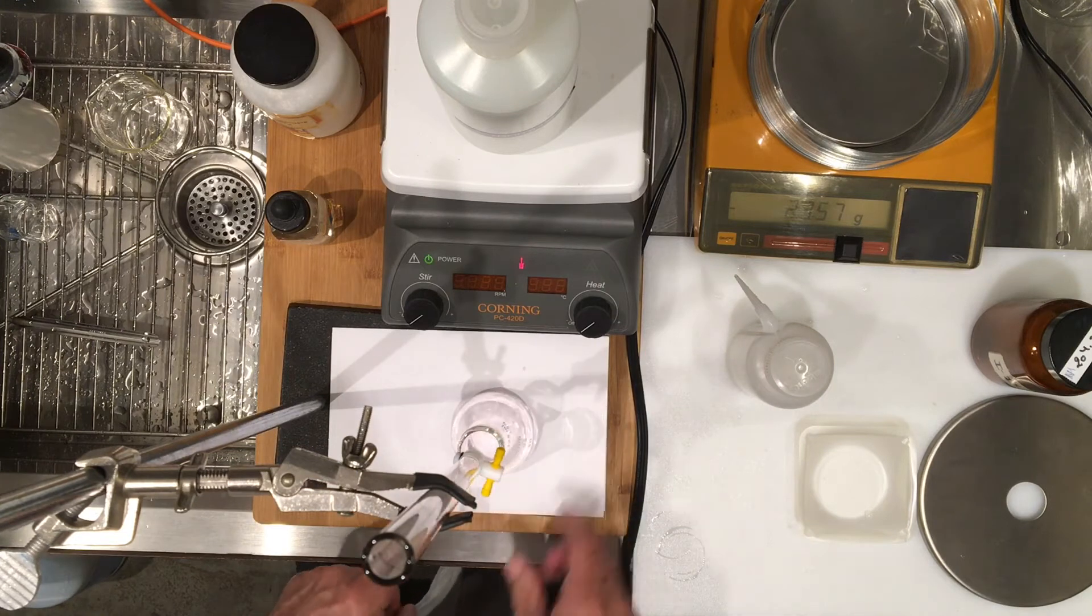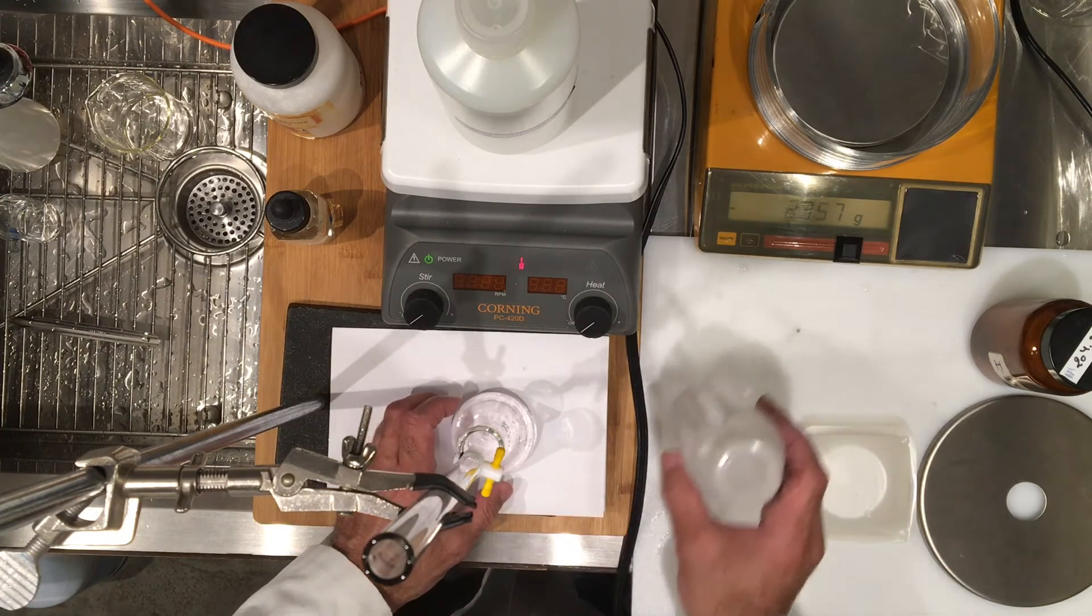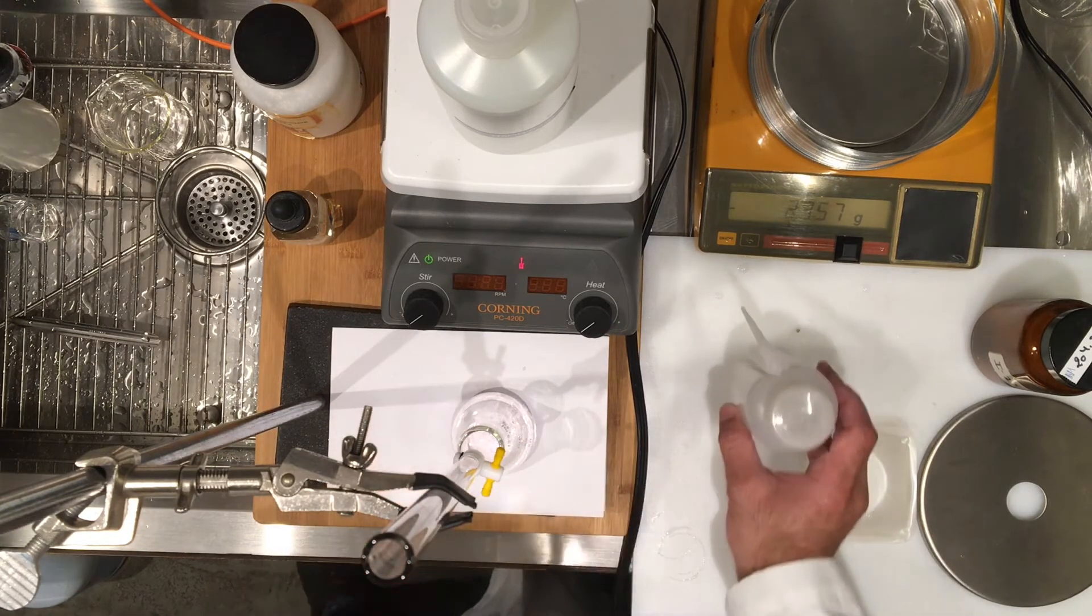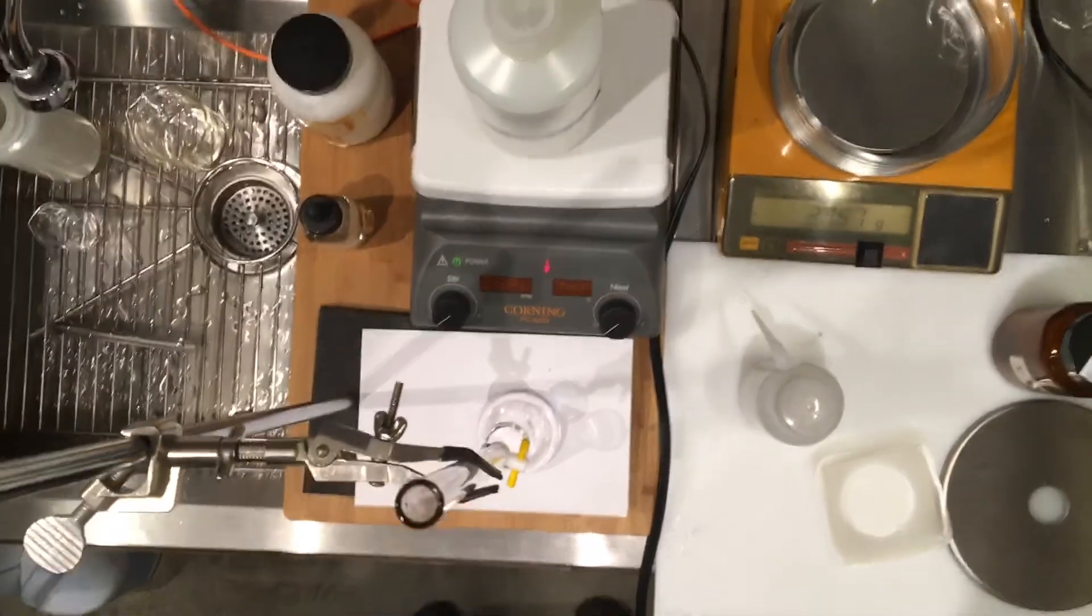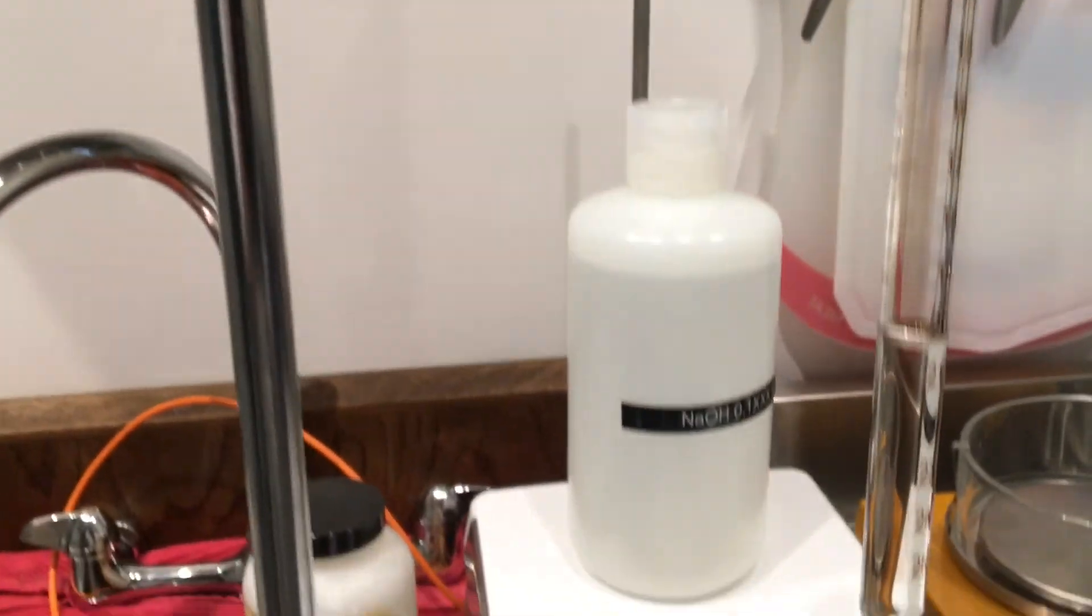I'm going to show you actually the hanging drop, so here it is. It's probably easy for you to see. There is a hanging drop right there, so I'm going to wash this hanging drop. Look at the color.